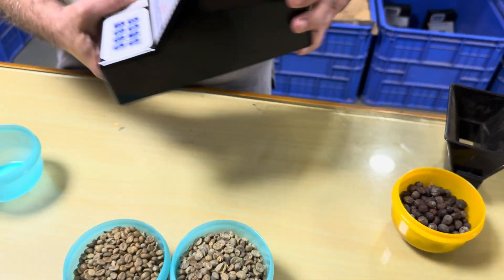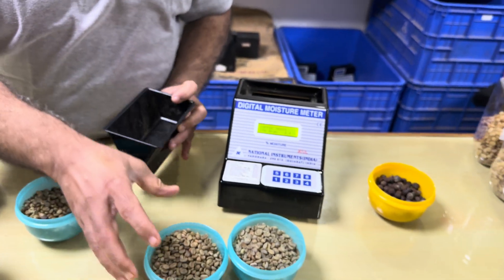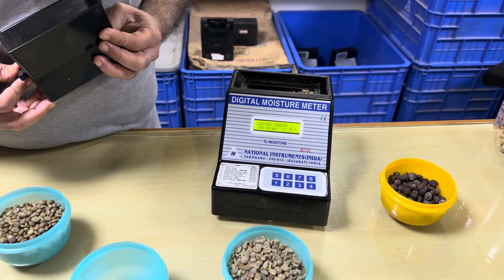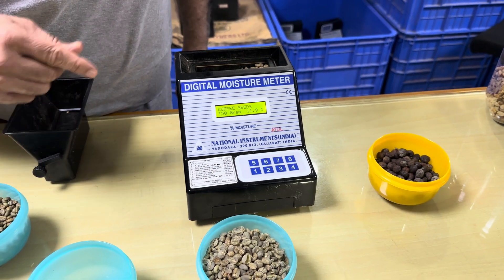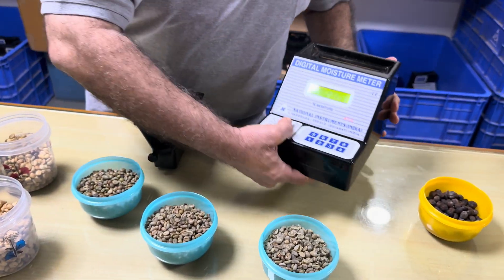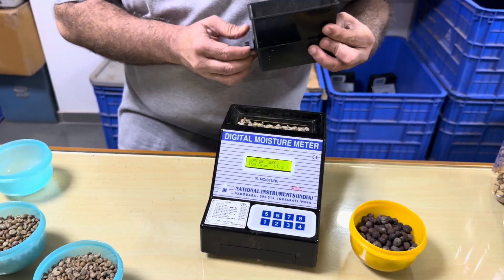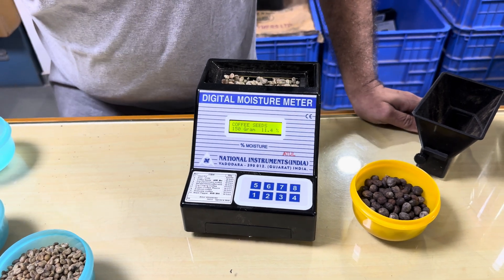I will remove this sample and show another. I have another sample also weighed at 150 grams — I will pour it into the instrument. Here you can see it is 11.9% moisture. I will take one more sample of coffee seeds and pour it into the instrument. You can see this is 11.4% moisture in this particular sample.